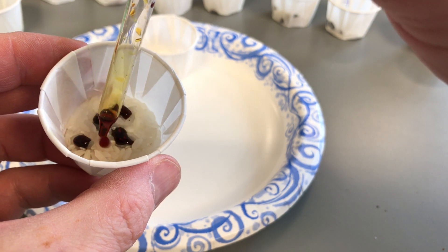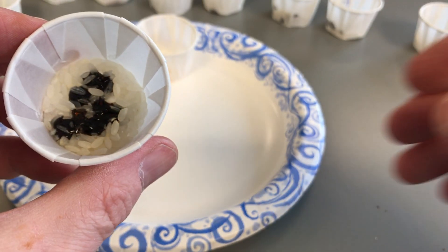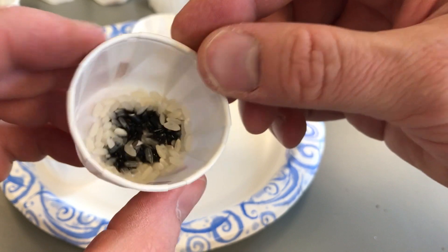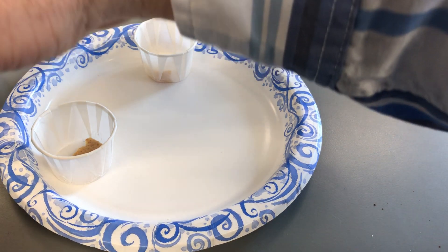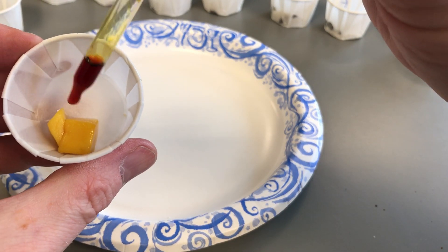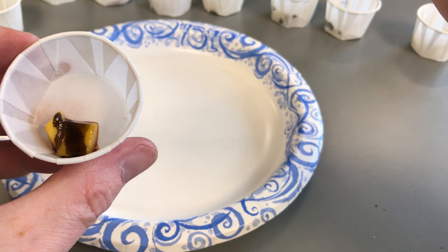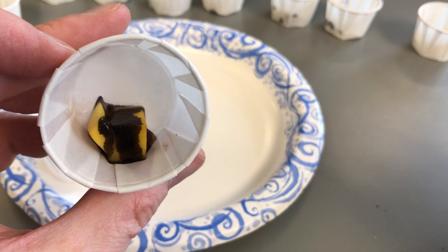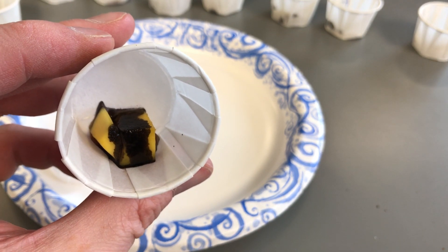Next is rice. Keeping the iodine on the rice rather than the paper, notice what happens instantly — even though most of it is on top, those rice particles get darker and show a positive test with a black color. Then mango: the mango gets darker pretty quickly. Some runs off but the mango did get darker well and fast — high in starch. When it turns black, that's a positive test result for starch.